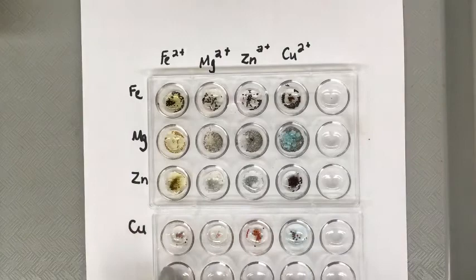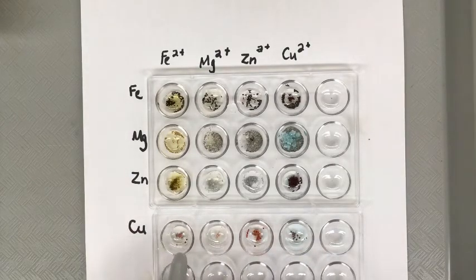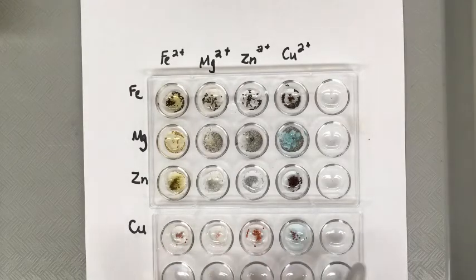And then copper, the final one, you look all the way across and there has been no change in any of them. The particles stayed orange, the solution stayed the color. There are no bubbles. So X is all the way across.